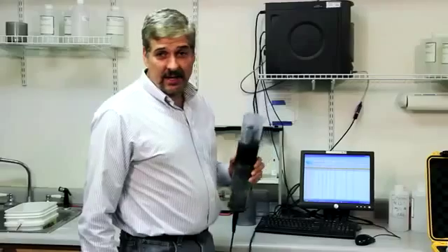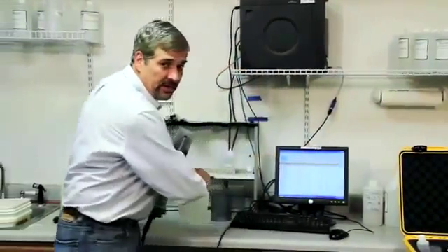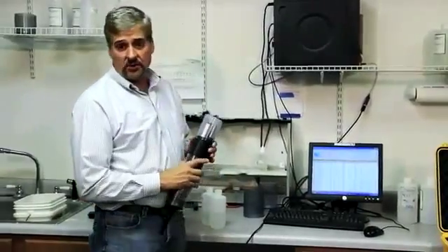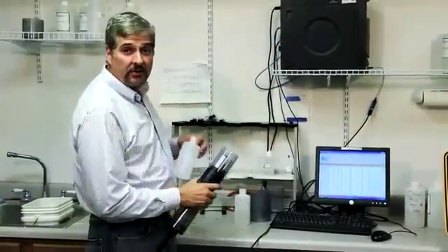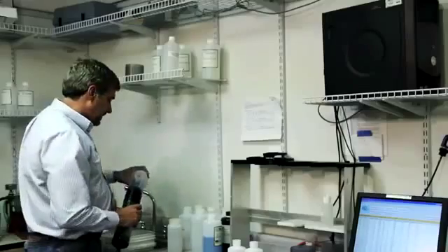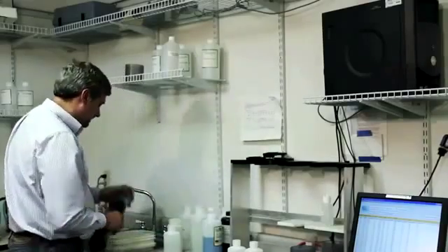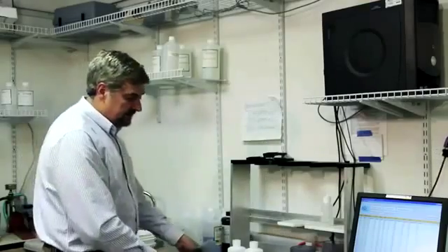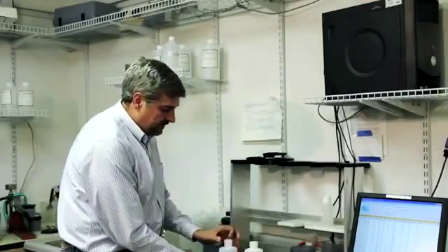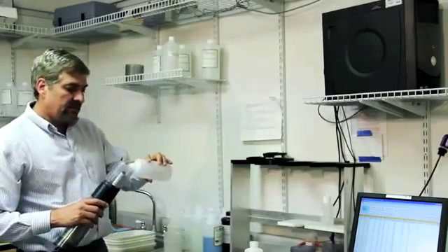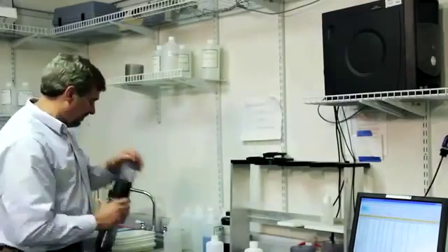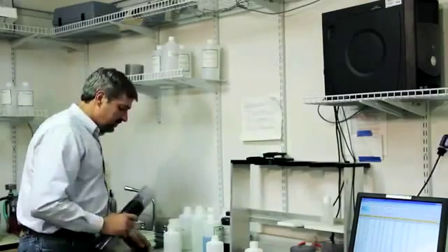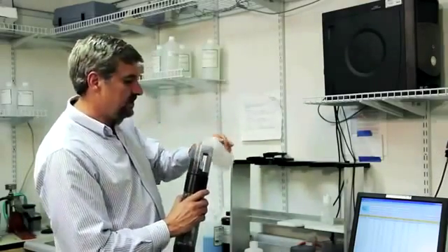Now we're going to calibrate turbidity. Turbidity is a two point calibration. You calibrate your zero and your slope. Zero is calibrated first. I'm going to rinse with my DI water and skip one of the rinses. And I'm doing my turbid free water, my zero solution, which is the first calibration for turbidity. Cover the sensors.